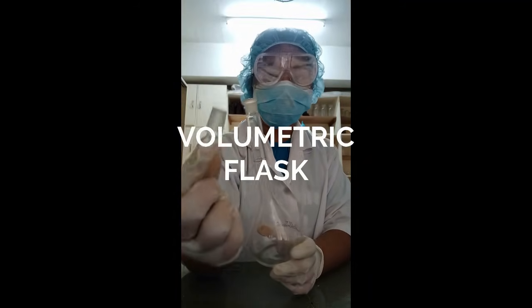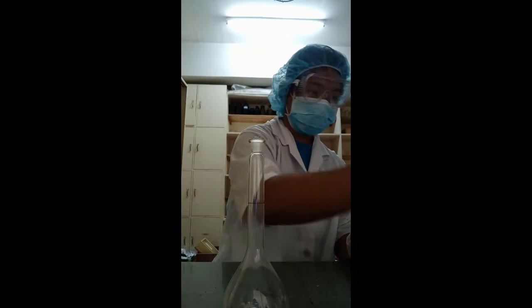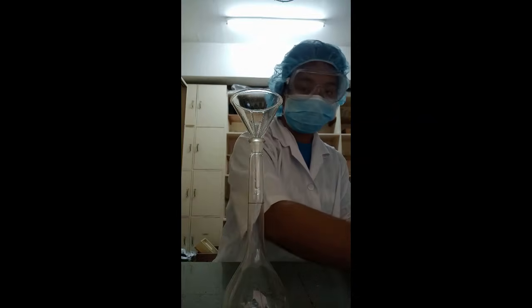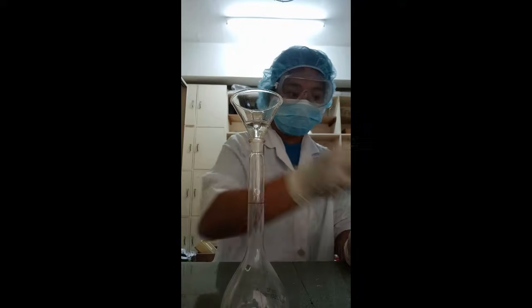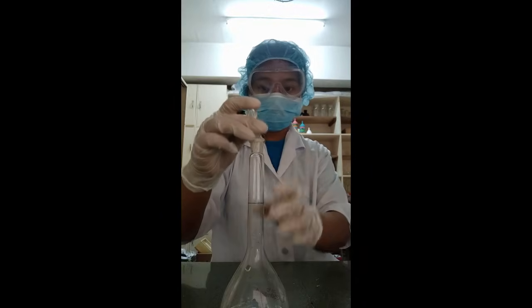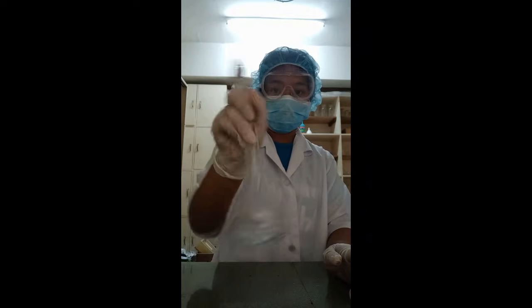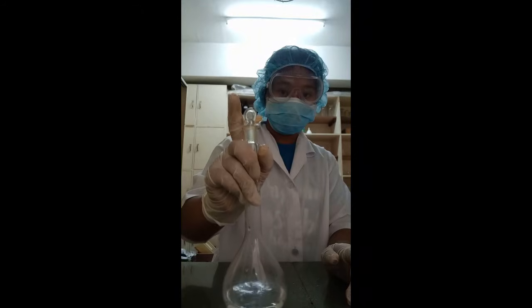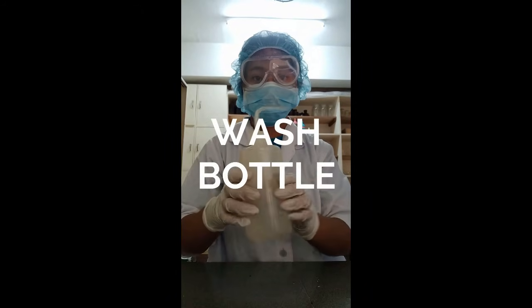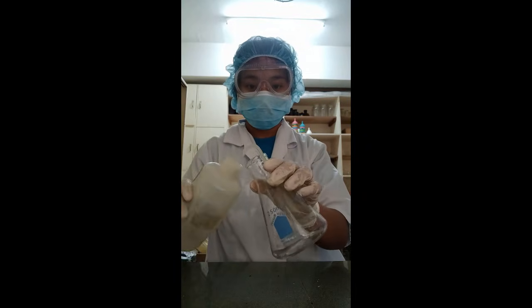Volumetric flask. It is a round flask with a long neck and a flat bottom. It is used to measure an exact volume of liquid and comes with special caps that will not let anything in or out. Wash bottle. It is a squeeze bottle with a nozzle used to rinse various pieces of laboratory glassware.